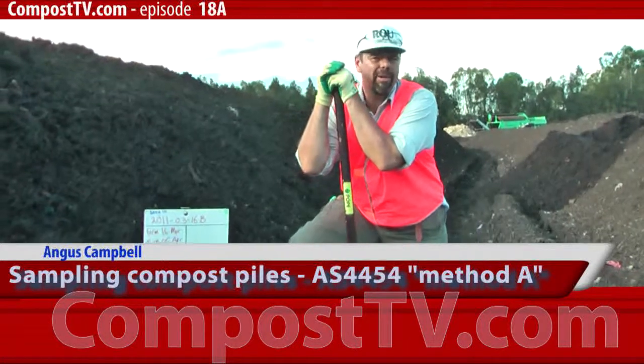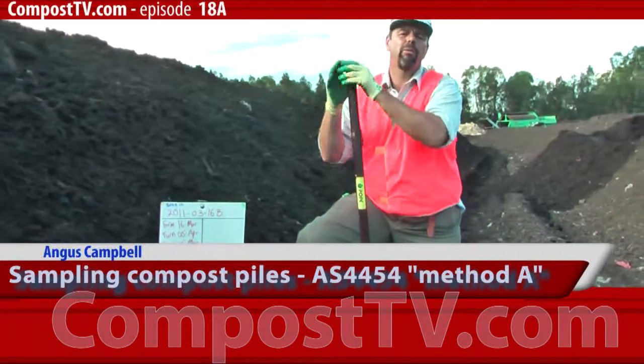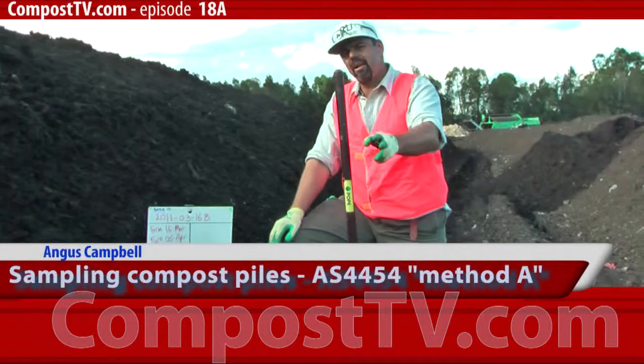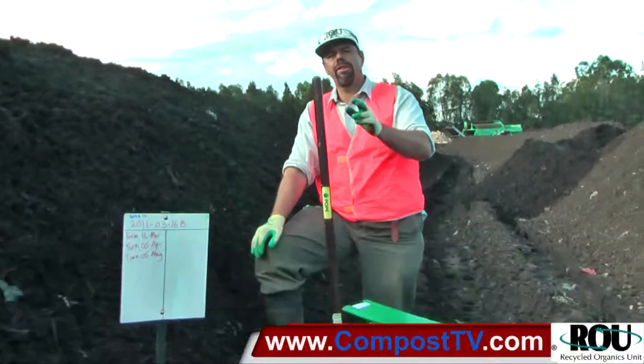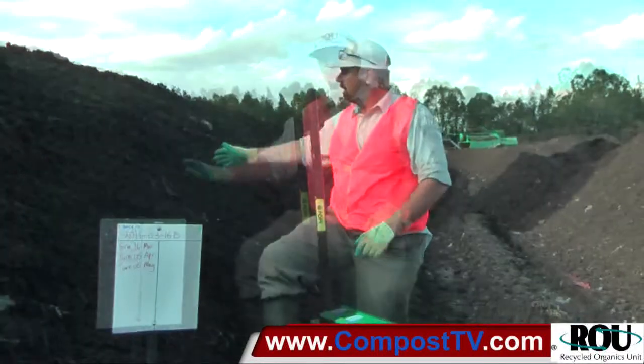So we're here sampling today. We're sampling a windrow, and we're looking at Method A. Method A for sampling relates to windrows that have been thoroughly homogenized and mixed.